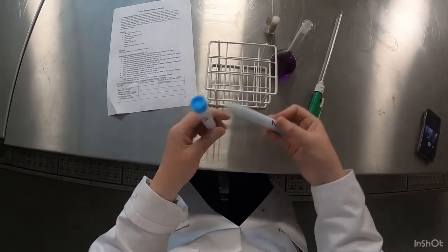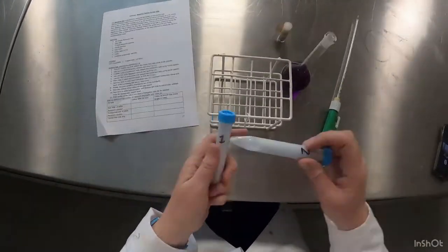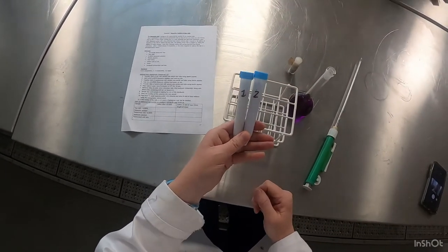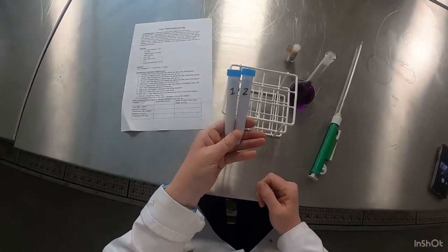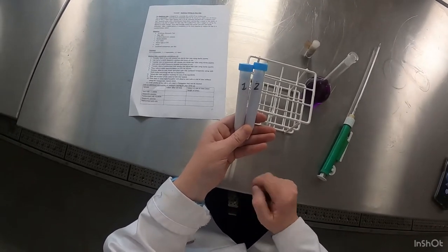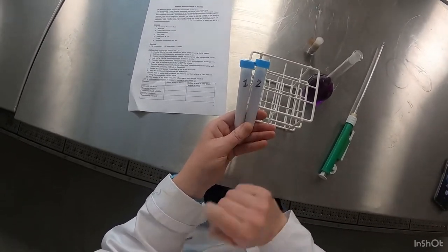Now as you can see at the start, I'll give them a good shake here. Both samples are like a blue color. Sample 1 and sample 2, they're both the same color at the start.